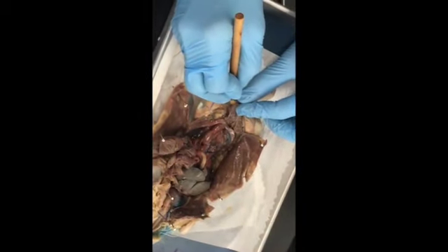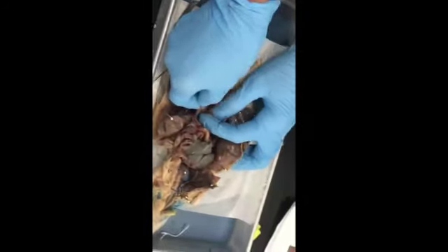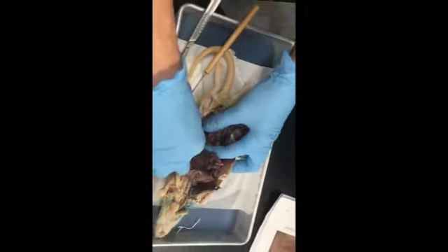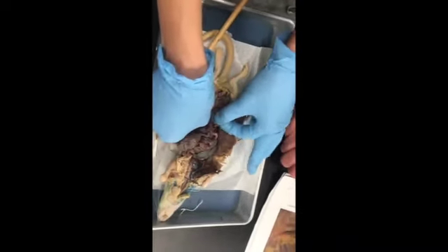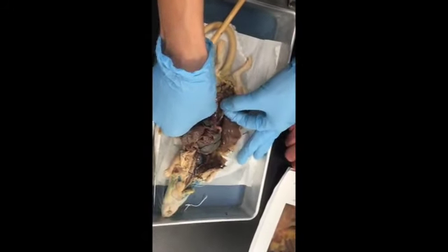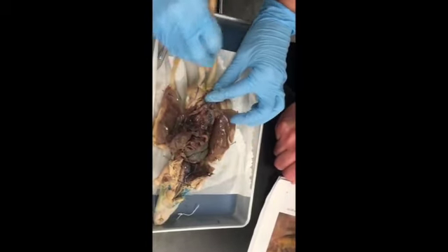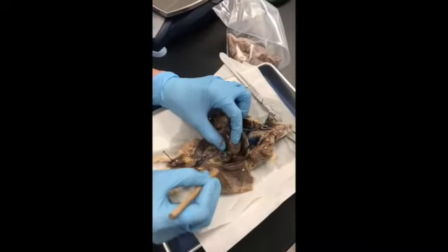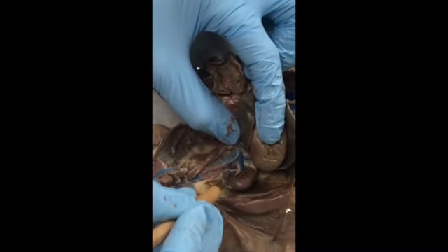is right here. So this is the bladder, and then in the female, you have a, let me separate this out, double horned uterus. So if she had babies, she would have babies all along the double horned uterus. So she'd have baby, baby, baby, baby, baby, baby. And then the double horned uterus comes together in the vagina, which is this part right here. Questions? Okay. Kidney, ureter. This is your renal vein here.